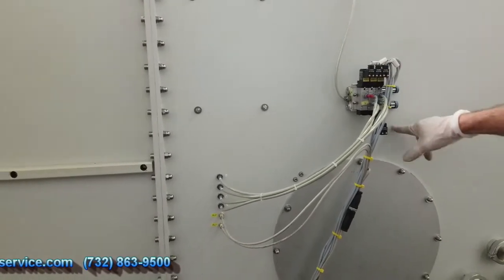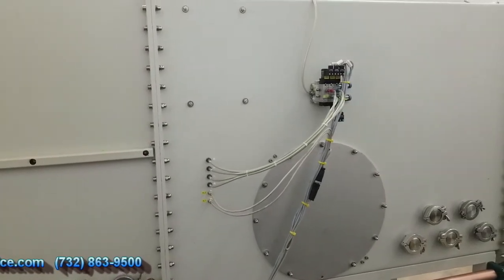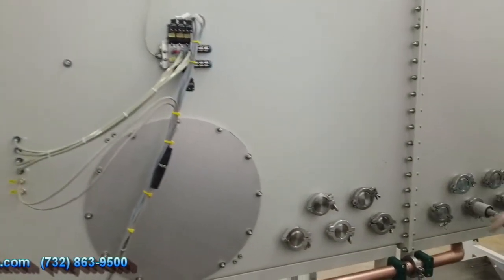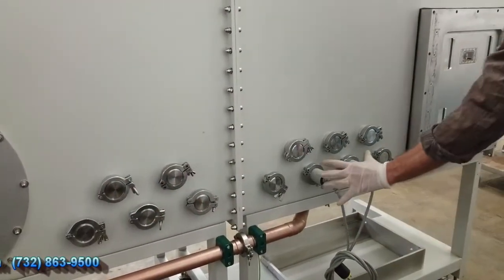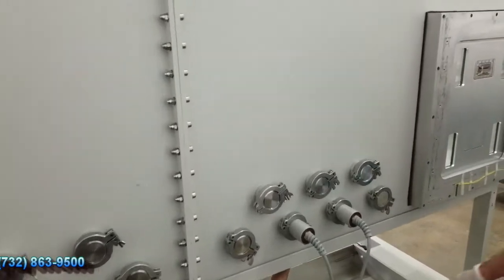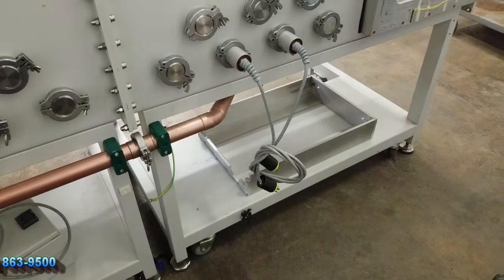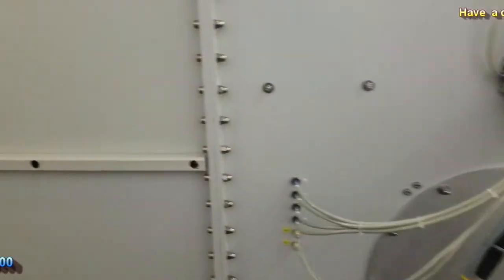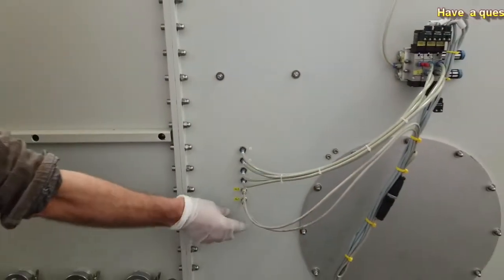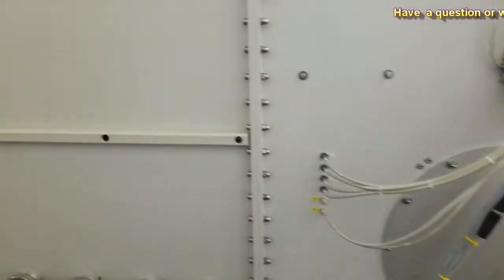I'll demonstrate that the inner door does work. So I just basically connected all the lines up and it works, so there's no problem with that. I'll pull these two out when I ship it, and I'm going to separate each box. So at least you won't have the depth here. And I took off this box that was underneath. I'll place that underneath, we'll send that along too. So I guess the only other thing would be I want to demonstrate that that door is functional. So these are the air lines going in, and then our two sensors for indicating where the door position is.